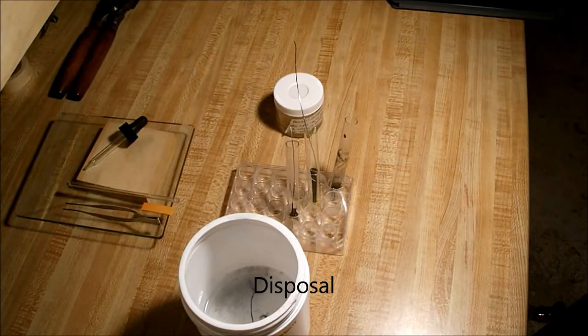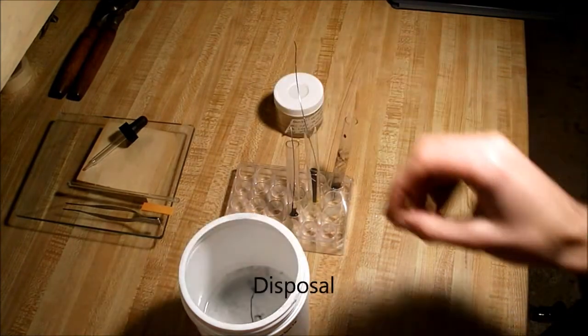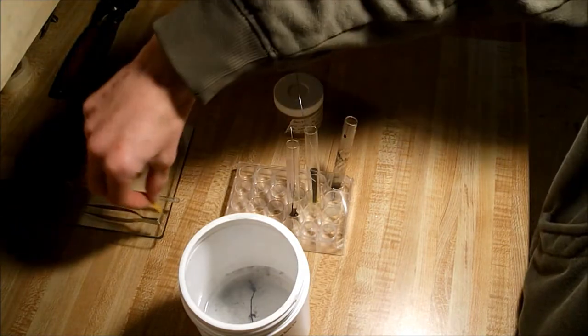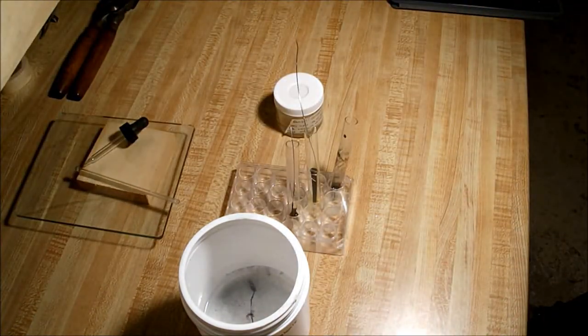Alright, finally for our disposal portion of this experiment, you want to handle all your compounds with care because sometimes not all the hydrochloric acid dissolves out and they still generally are acidic.